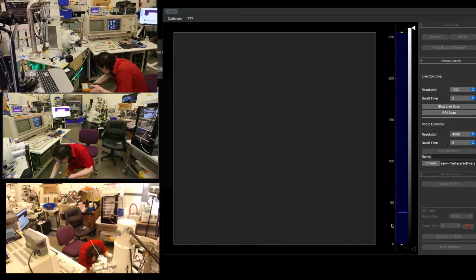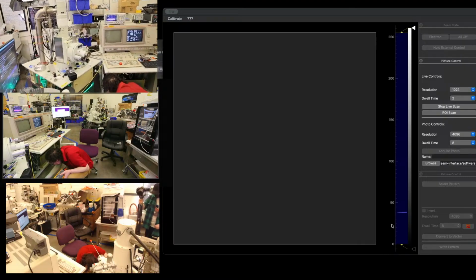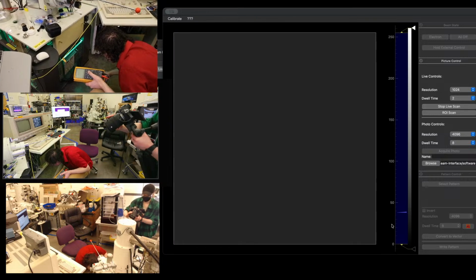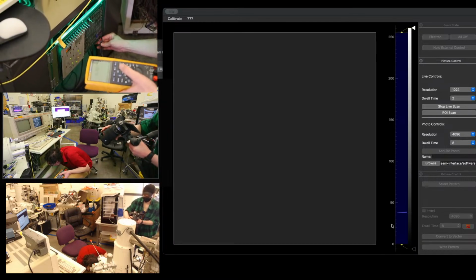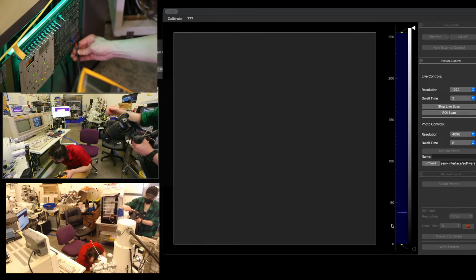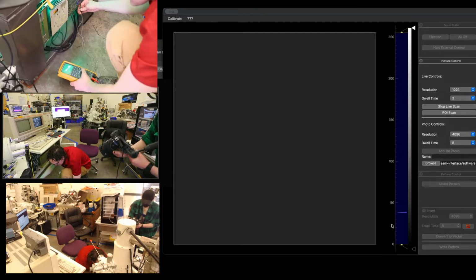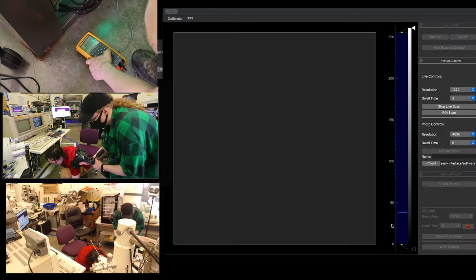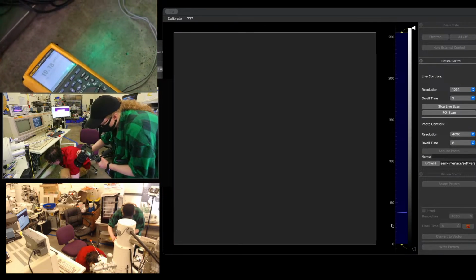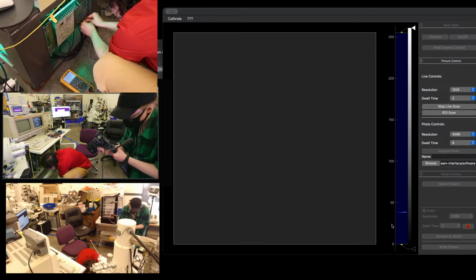So we want to check PG2, which is what sets the gun interlock pressure. I don't have clippy probes right now, so I'm just going to be holding these on, so that's going to be fun. Okay. Is that just removing these probes, or what's going on? Maybe I should have just grabbed the clippy probes.